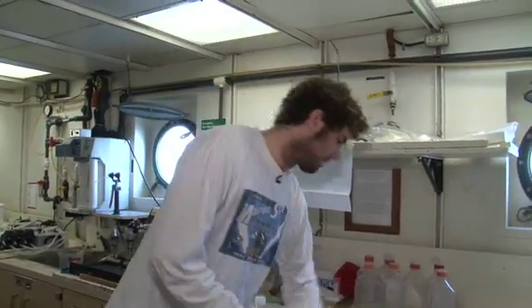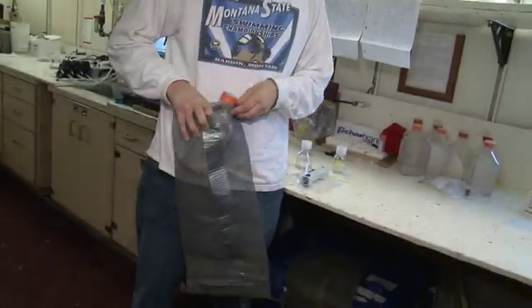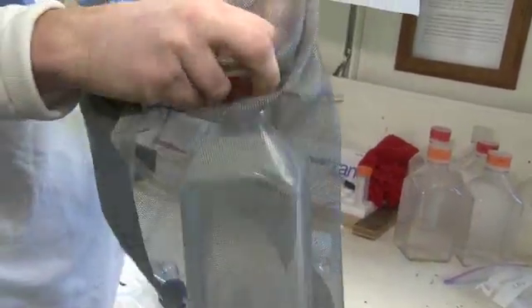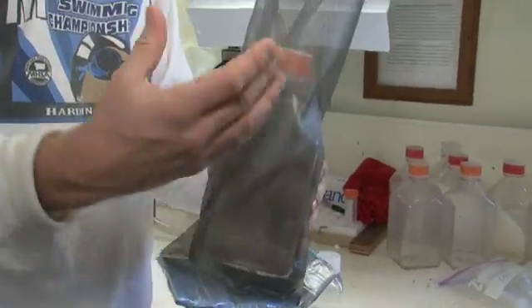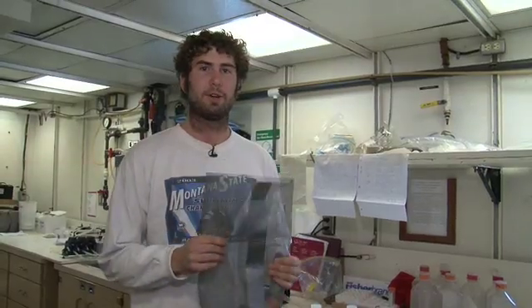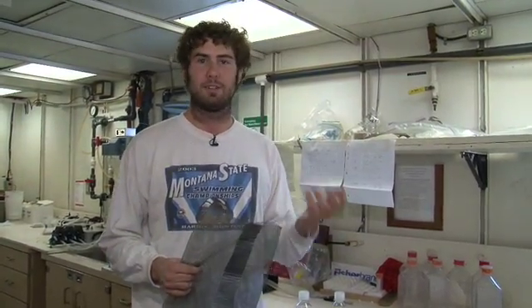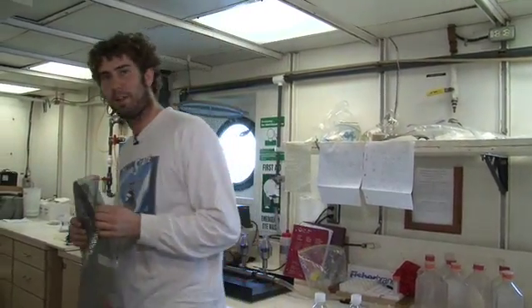Once you have done those additions, you put your sample into this screen bag here, which blocks out about 50% of the surface light, so it simulates light at the surface. We also have thicker bags that block out about 90%, so it's about 10% of the surface light. Once you have your sample in the bag, you take it out onto deck where there's an incubator out there. So I'll head out there now.